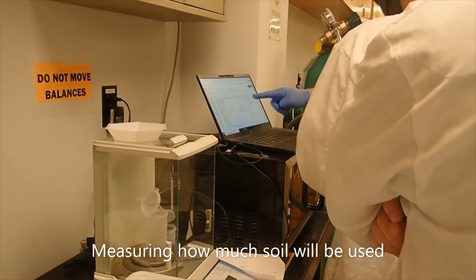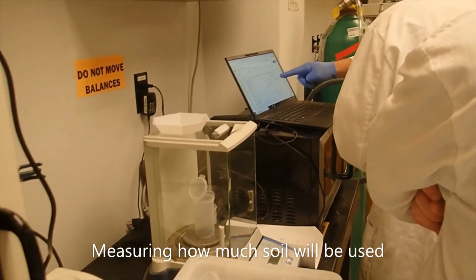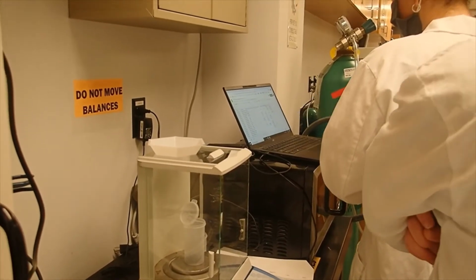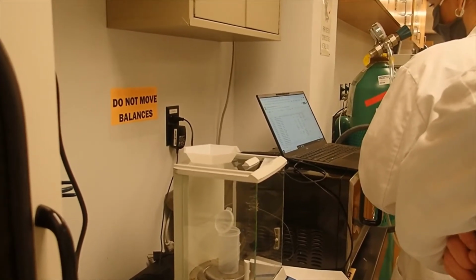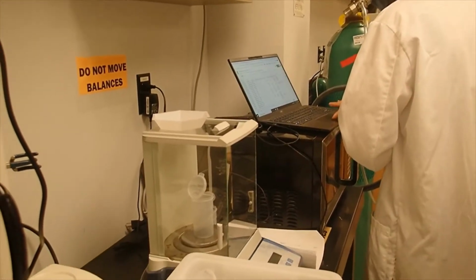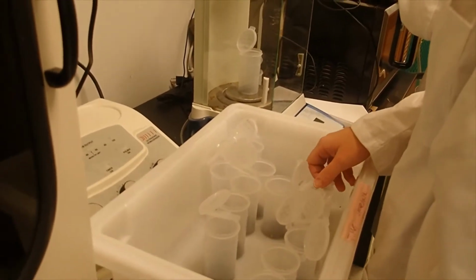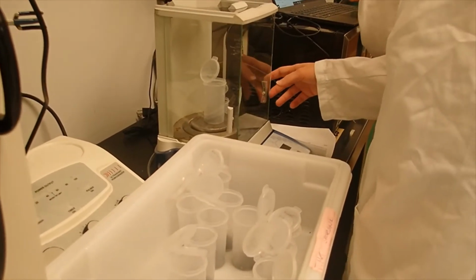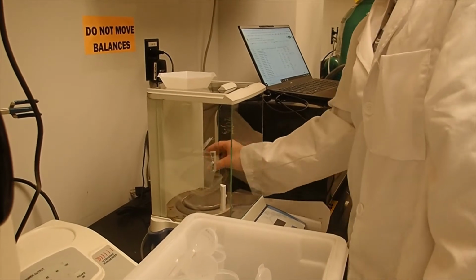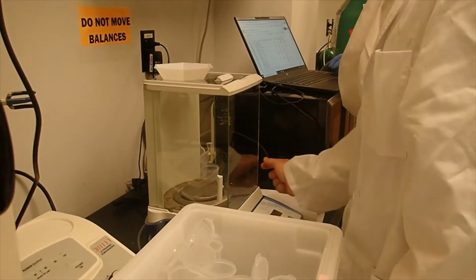All we have to do is measure the vial, subtract the vial weight. Oh, okay. But this is a little high, so I think we should take a little bit out of those. Okay. And you want to take a little bit out and remeasure them, because we want it to be under a gram. So you can do that.